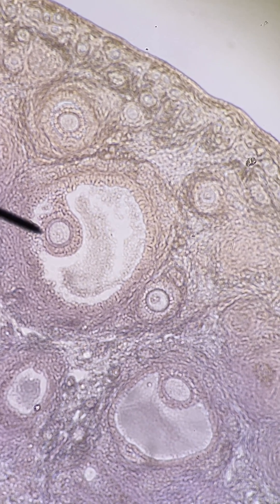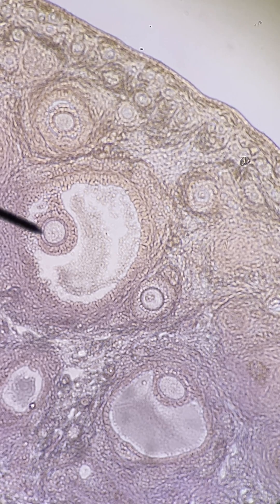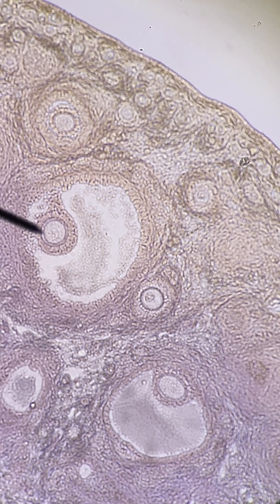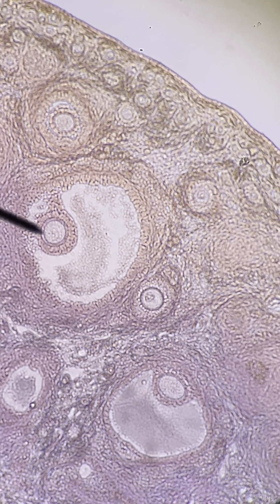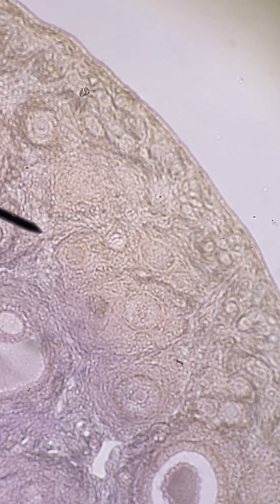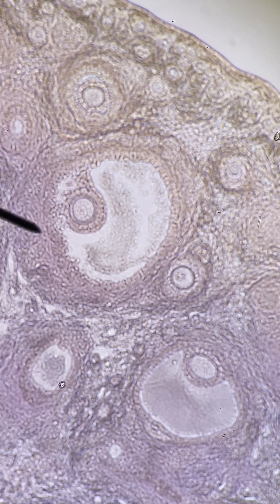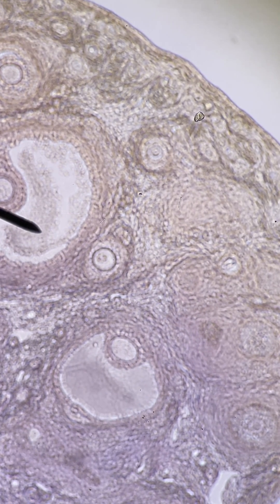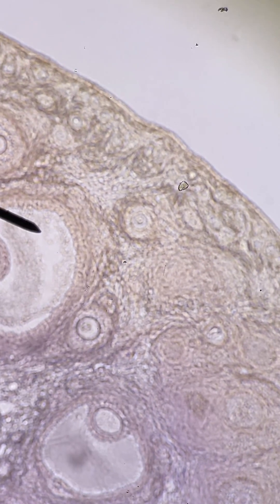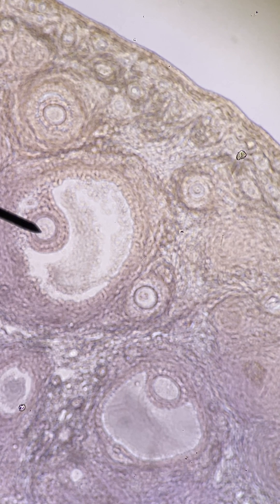This would be a secondary oocyte. By the time you get to this stage — by the time you get to a vesicular follicle — you've got a secondary oocyte, but that will make sense with a later video. Right now this pointer is inside the lumen of the follicle. The follicle is the whole big structure here, with the oocyte being this little guy right there.